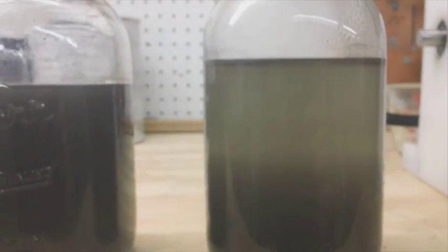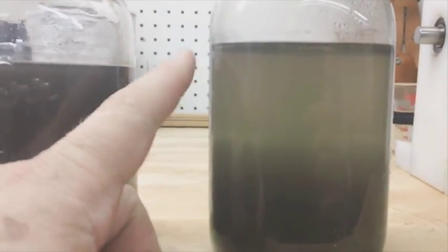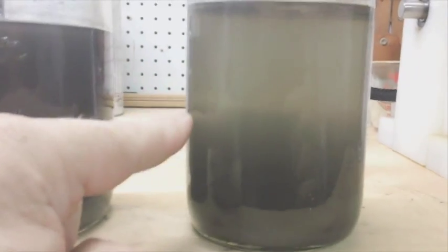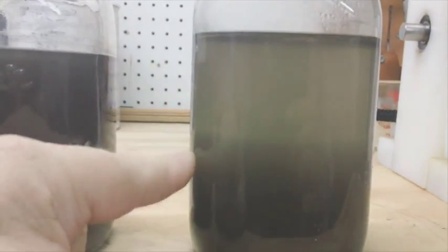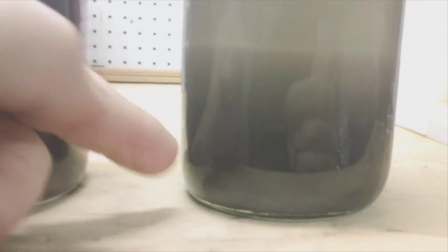This is Technomancer for Zero Point Fuel, day three. Okay, this is what I ran on Sunday, which has been three days. You can see the separation happening there, and it's a little hard to see, but there is a lot of graphene floating in the acetone because the acetone is the upper part of this and the bottom is the water.